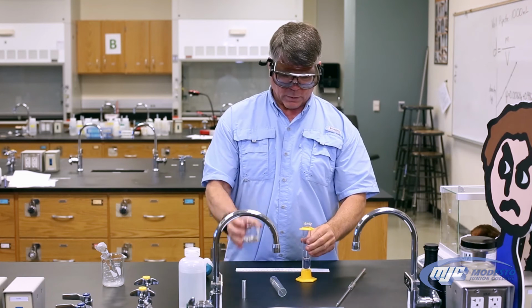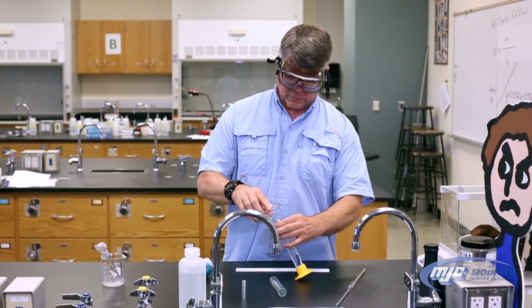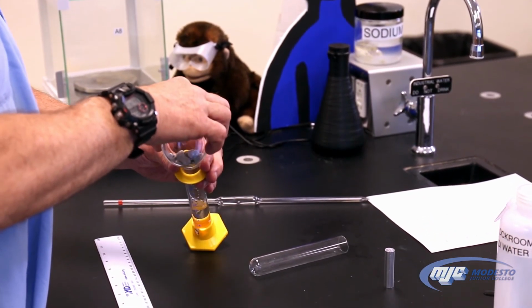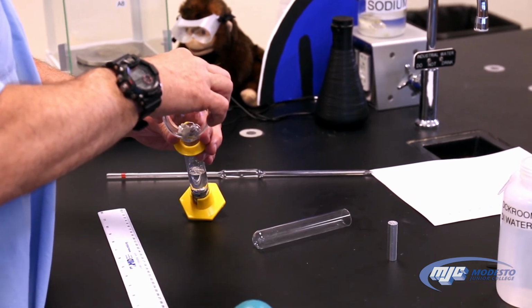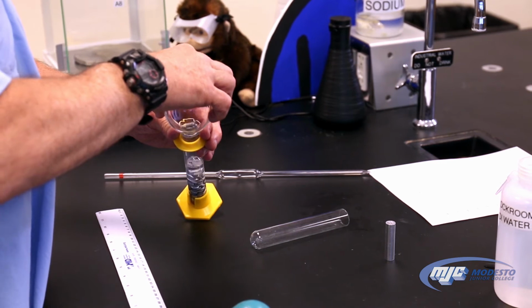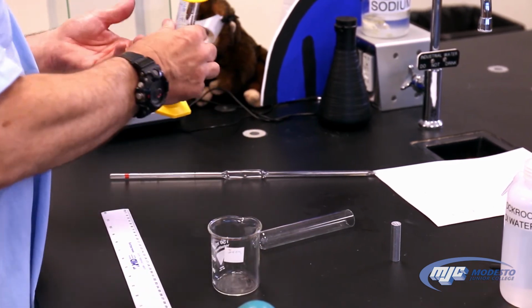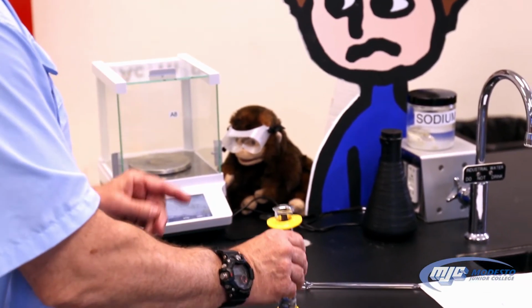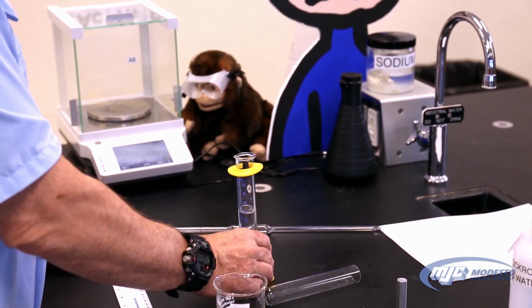Once you get that, take the metal shot and once more carefully pour this into the graduated cylinder. Careful not to splash any water out and not to break the graduated cylinder, because some of this metal, if you pour it too fast, it definitely will break that graduated cylinder. And you got water everywhere, and you need a new graduated cylinder. Now what happens is sometimes bubbles of air get trapped in here, so what you do is gently tap it on the counter, make sure everything's settled in, no water bubbles in there.